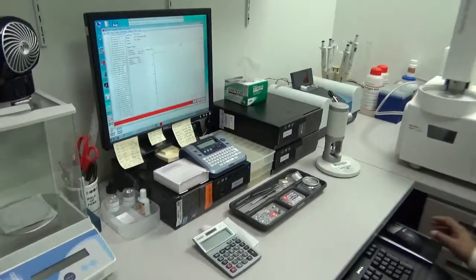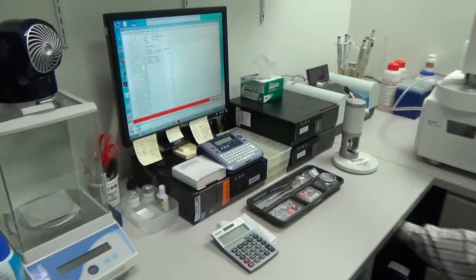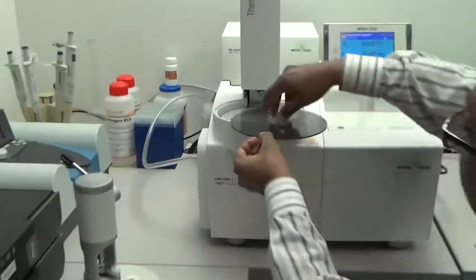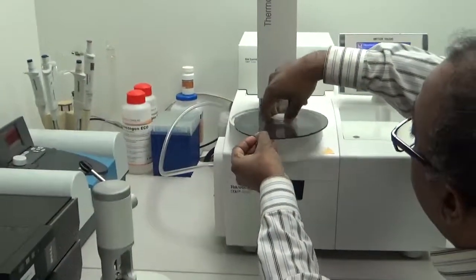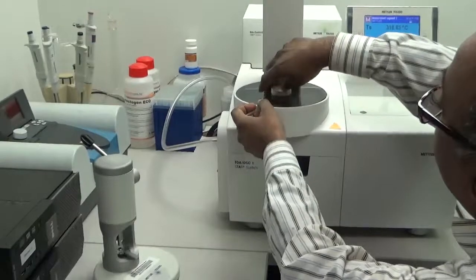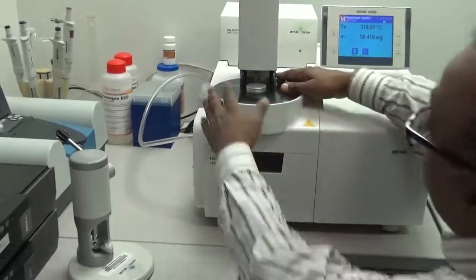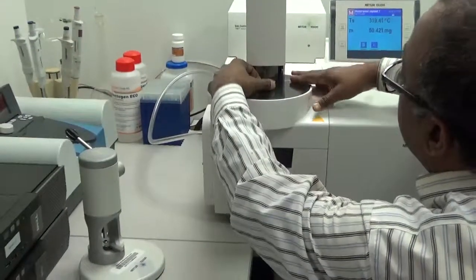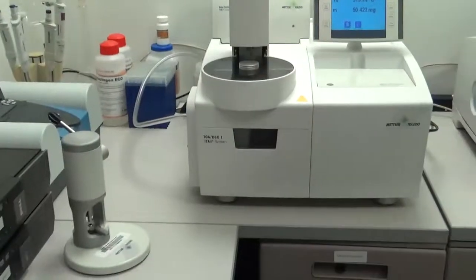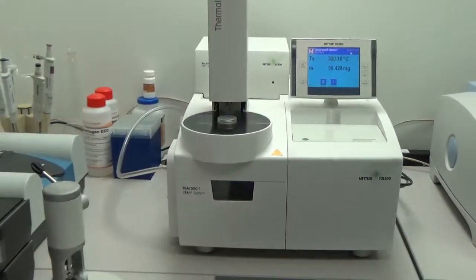So that's pretty much it — how we do our thermal analysis. Let this experiment run and you'll see how we get the evaluation part done. We usually keep this cover on and let it run. Thank you.